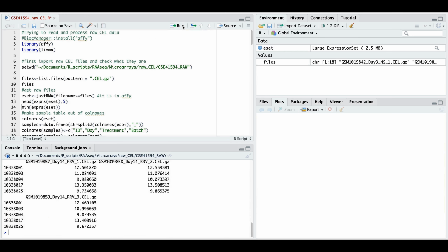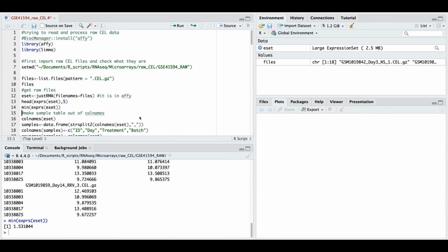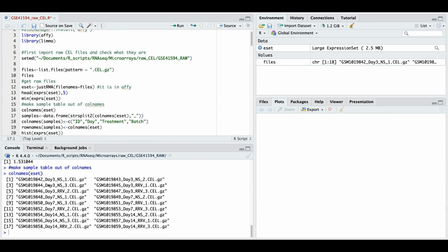So let's investigate a bit. Here are the numbers instead of gene names. The column names are inherited from the CEL GZ files. The minimal value here is 1.5. It's okay. These are the column names, which are good to generate a sample table.